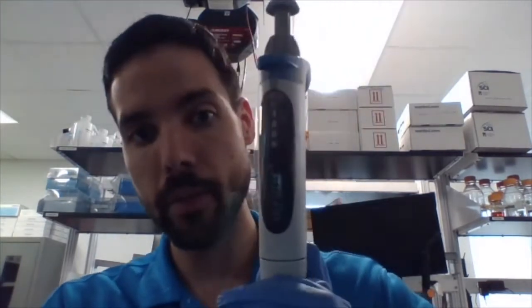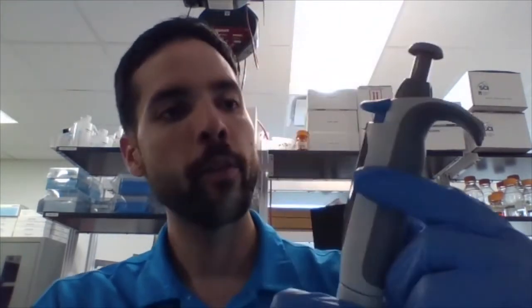However, there's one micropipette where that line does not represent a decimal point. It represents a comma. And that is the only number between P10, P100, and P1000 where we actually have a comma. We don't have a comma in 10. We don't have a comma in 100. We have a comma in 1,000. So only for that P1000 does this line represent a comma. So this is 1,000 microliters.